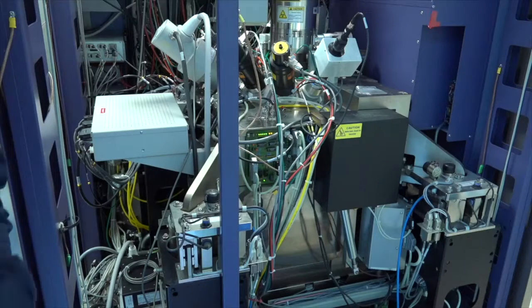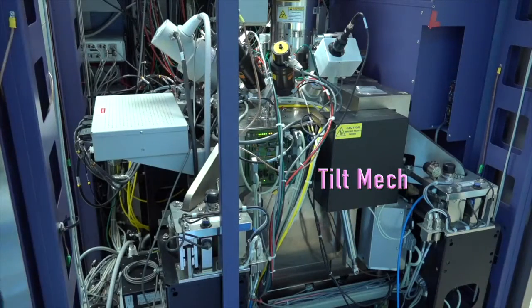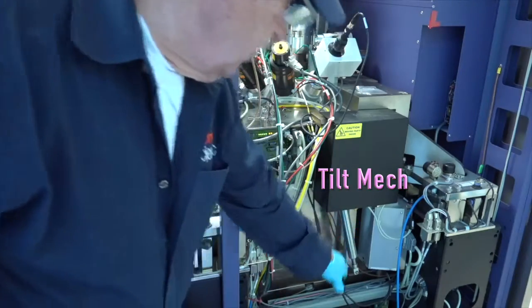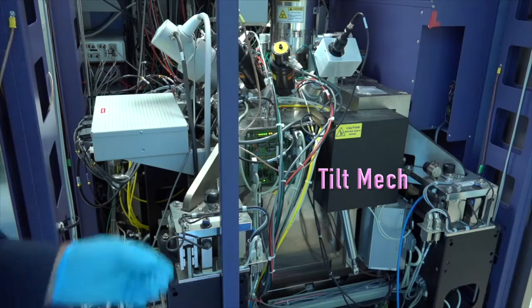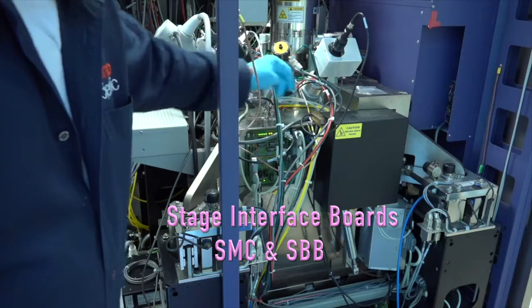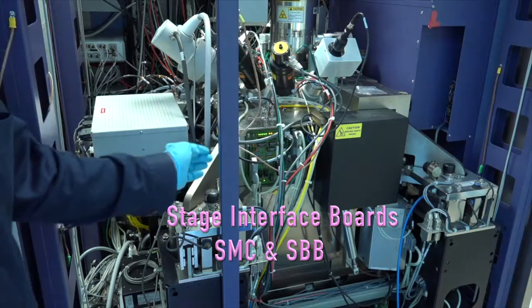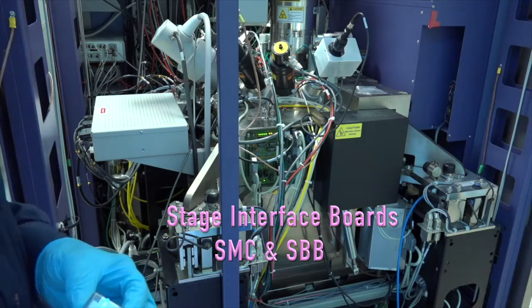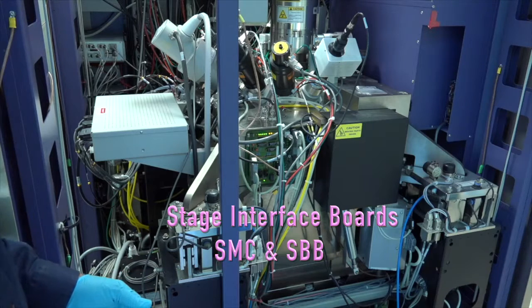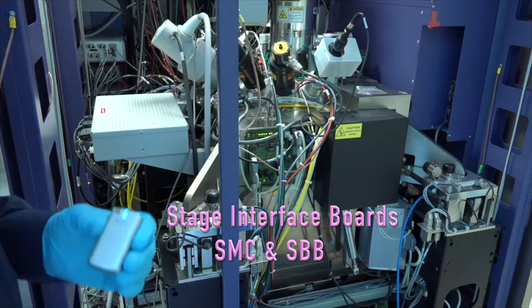All right, this is the fourth side of the tool. This side you can see the tilt mechanism in here. You can kind of see the heavy cylinder here that pre-tensions it. You can also see the two interface boards for the stage, what they call SBB and SMC boards. We do a lot of our stage testing with these boards. That's the last point, or the first point outside of vacuum. We get an opportunity to test the stage, and we do a lot of it.